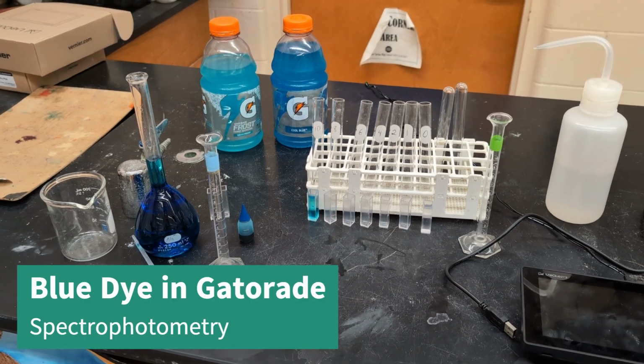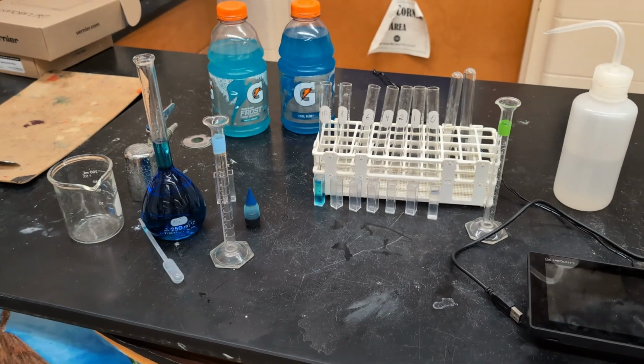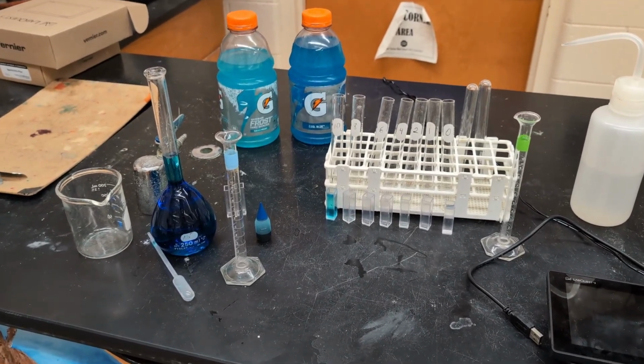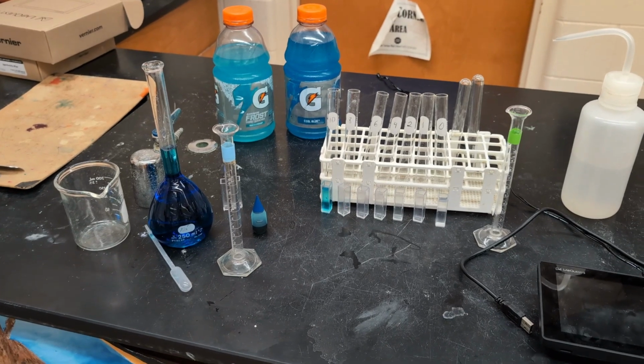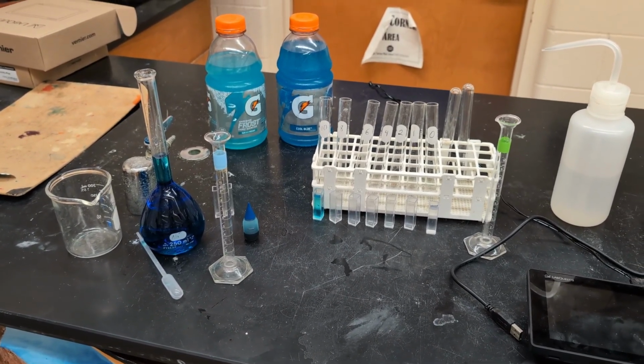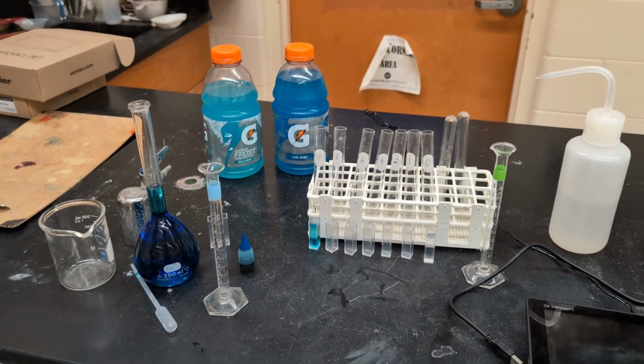Today we're going to be looking at the spectrophotometry lab related to the amount of blue dye in Gatorade. The first thing I did was create a stock blue dye solution. I wound up using 2 drops of blue food coloring in a 250 milliliter volumetric flask.